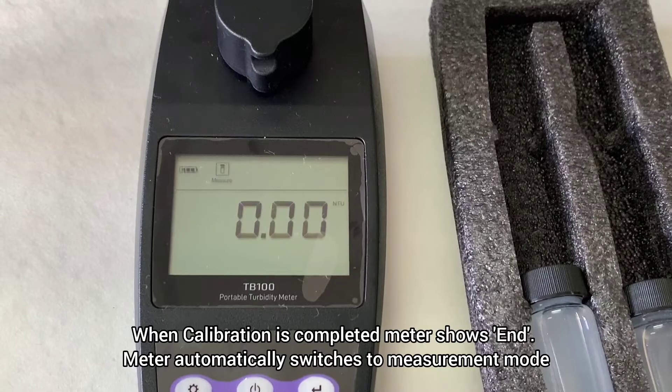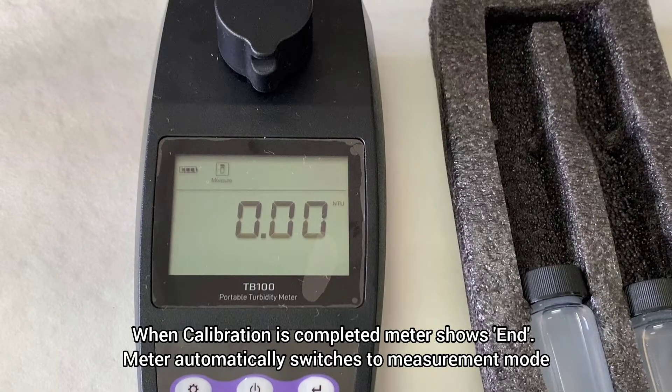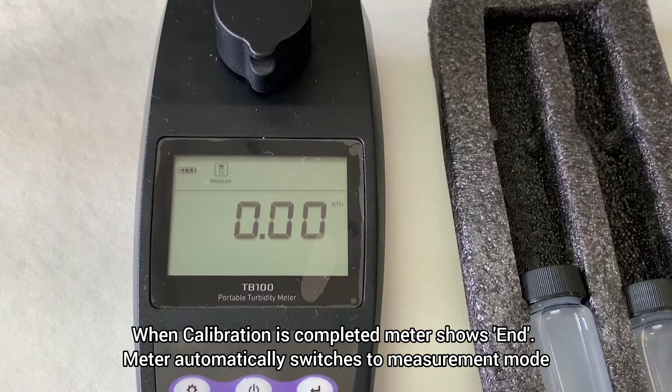When the calibration is completed, the meter shows END. The meter automatically switches to measurement mode.